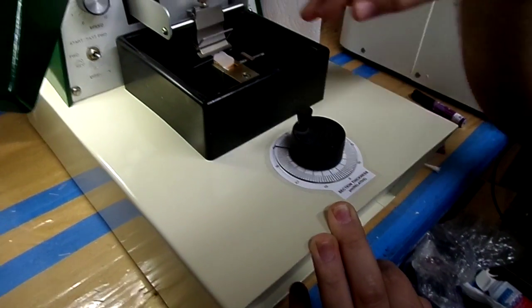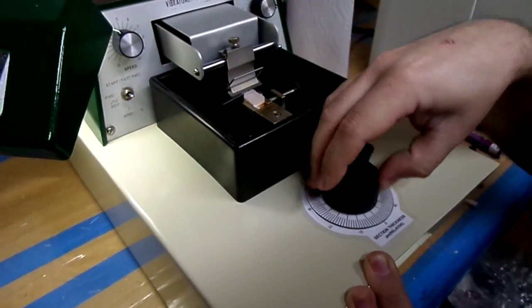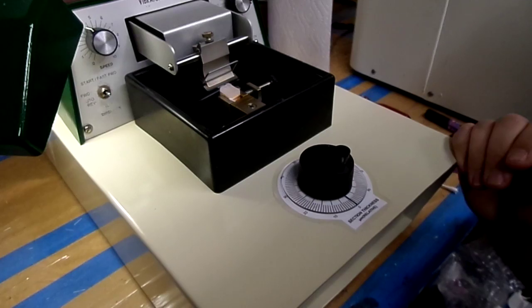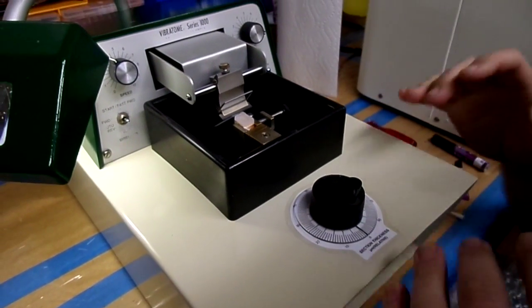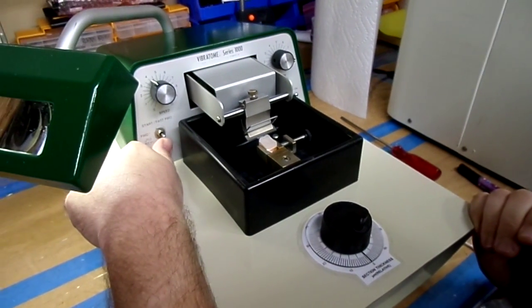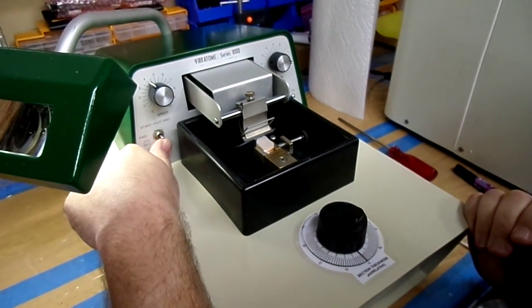So for our cut, I'm going to go ahead and do it at a thickness of 100, just because it's wax and it's difficult to cut wax on this machine, but it does a pretty good job with it. So I'm going to go ahead and start it.